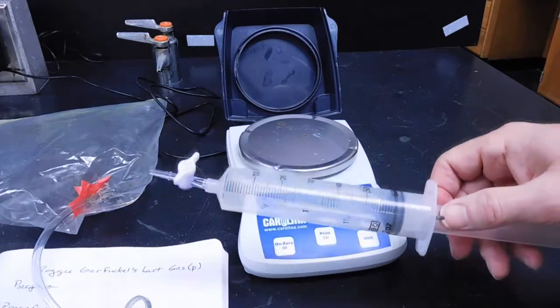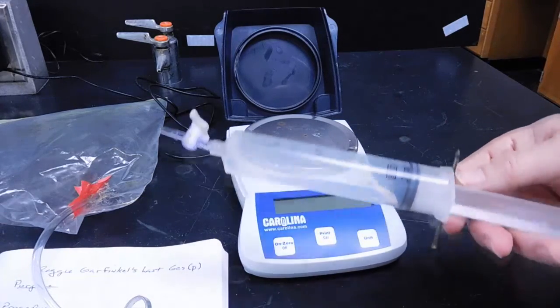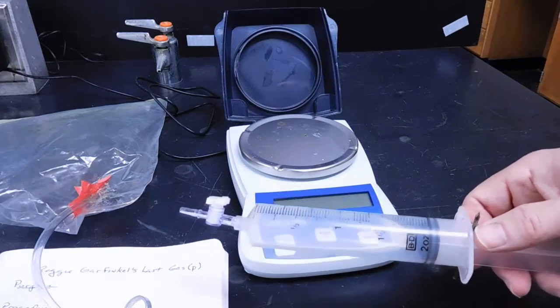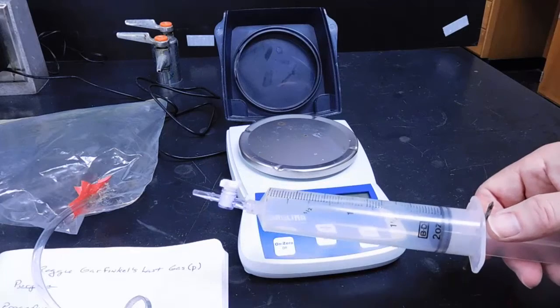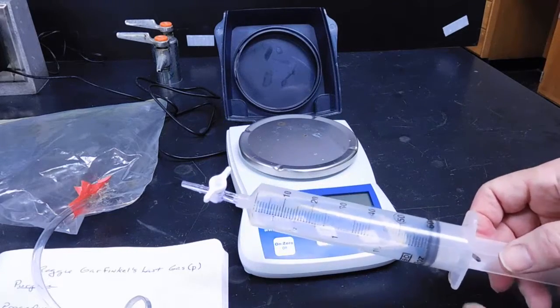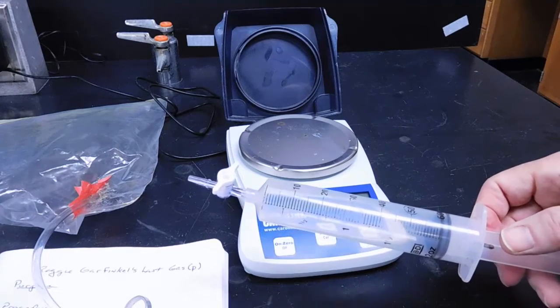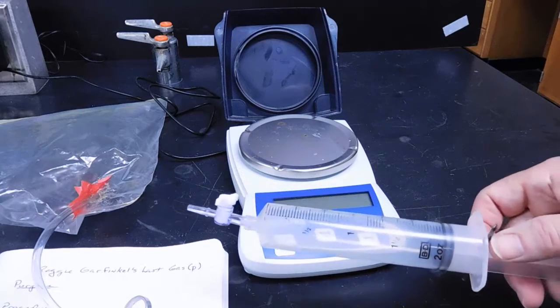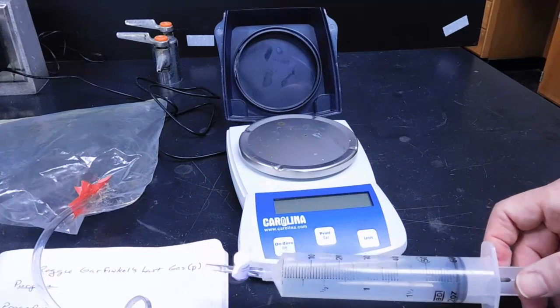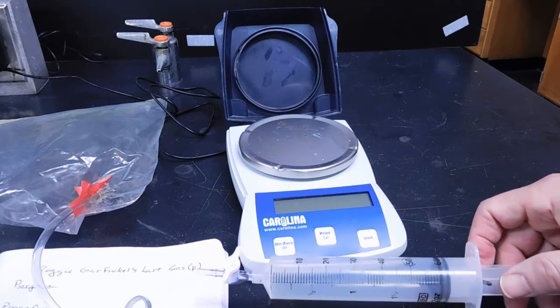Once we have that, we have the mass of the syringe empty, we have the mass of the syringe with either air or the unknown gas, we have the temperature and pressure of the room provided by the teacher. You have the volume. All you need to do is determine the molecular weight of the gas, and from that determine which gas you think may have killed Reggie Garfinkel.